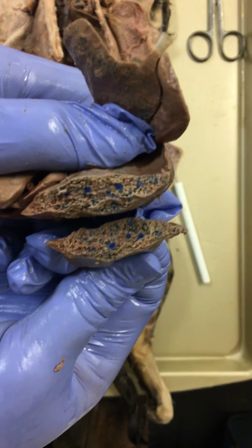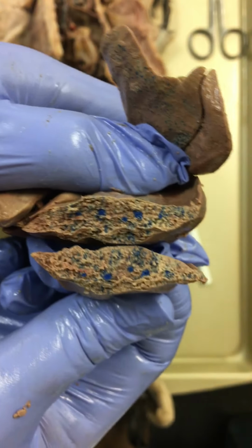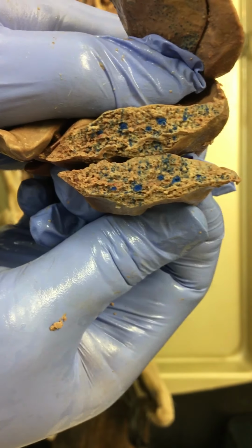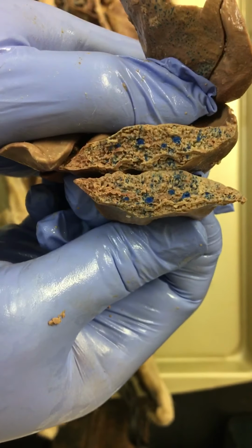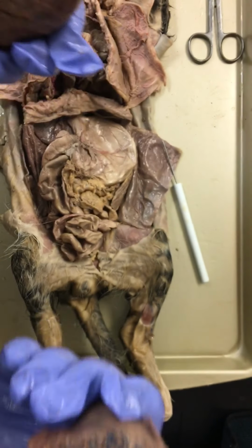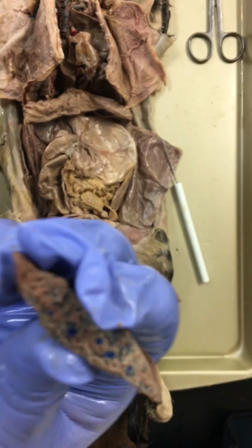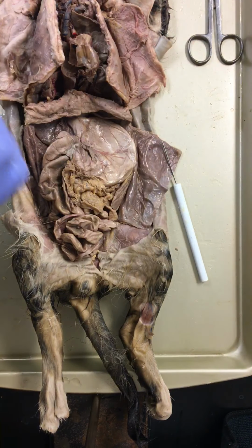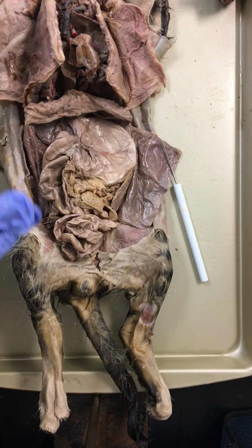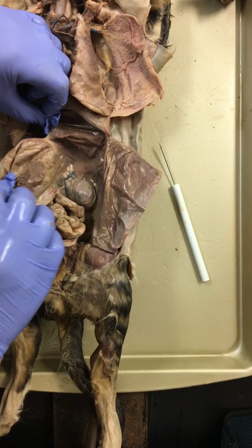So as we can see right here, the liver has a lot of blood vessels going to it. And so we can see the blue a little bit better than you can see the red in the video. But remember, we're filtering the blood. It's taking all the toxins out of the body. It's taking all the extra sugar and turning it into fat. This is a super important organ. And so without this organ, well, you just aren't going to make it. It is one of the organs that we can give a live transplant to. So you can just give a portion of it and it will grow back.